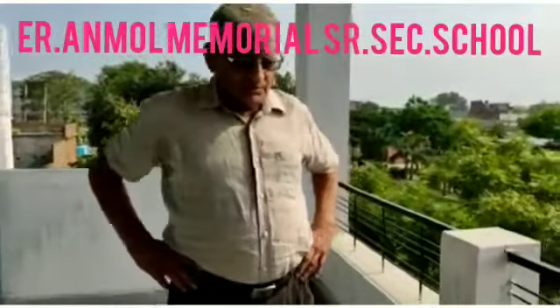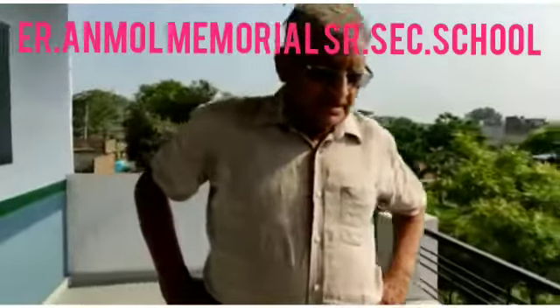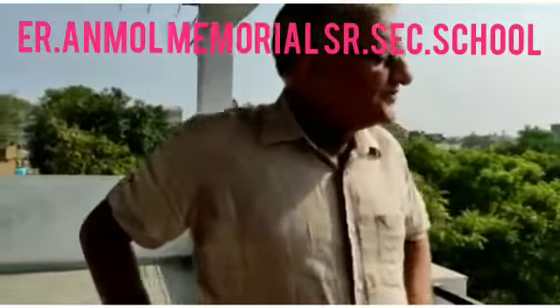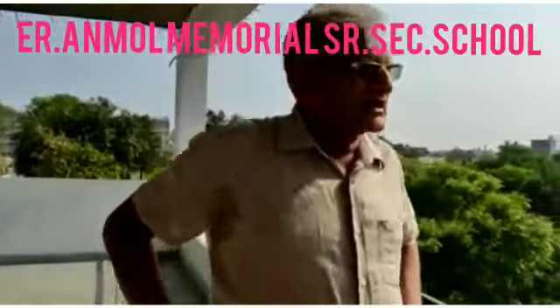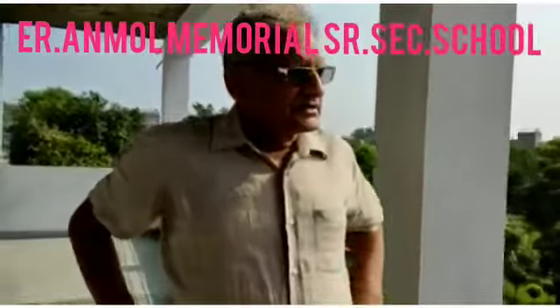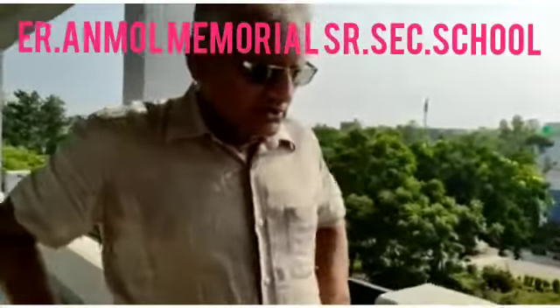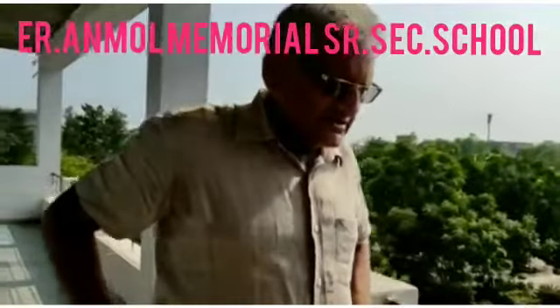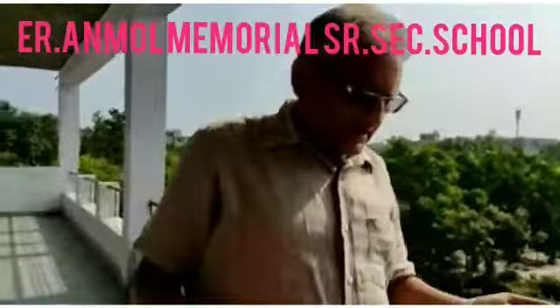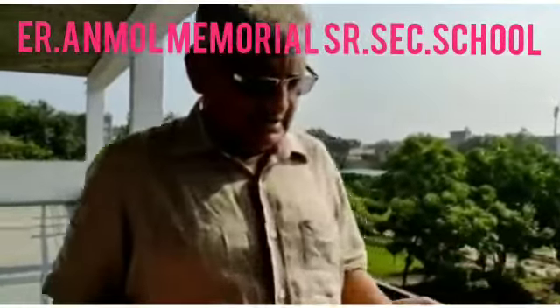Good morning students. I have seen most of the students who cannot set the stand, so I am going to cover all the parts of the stand.